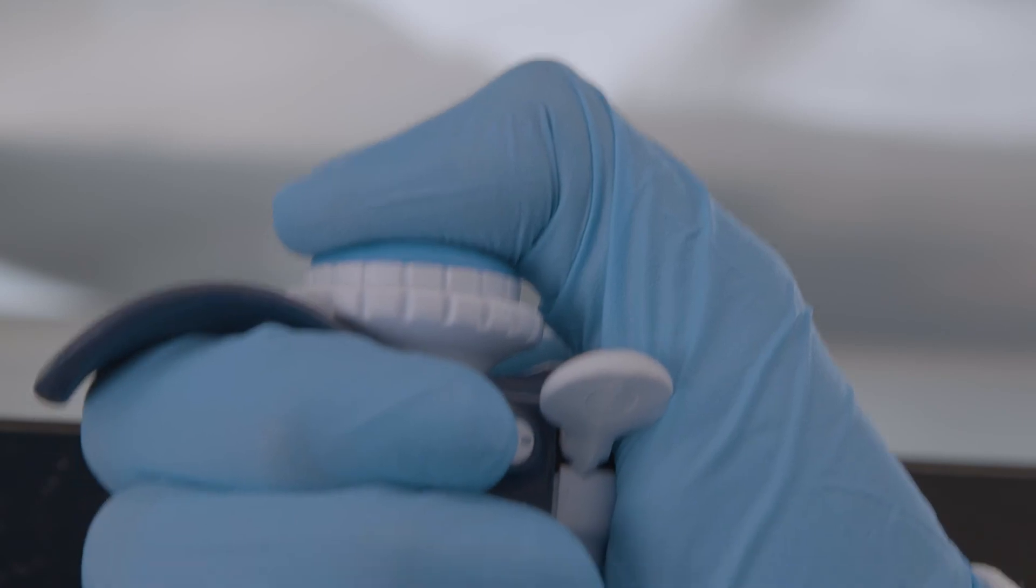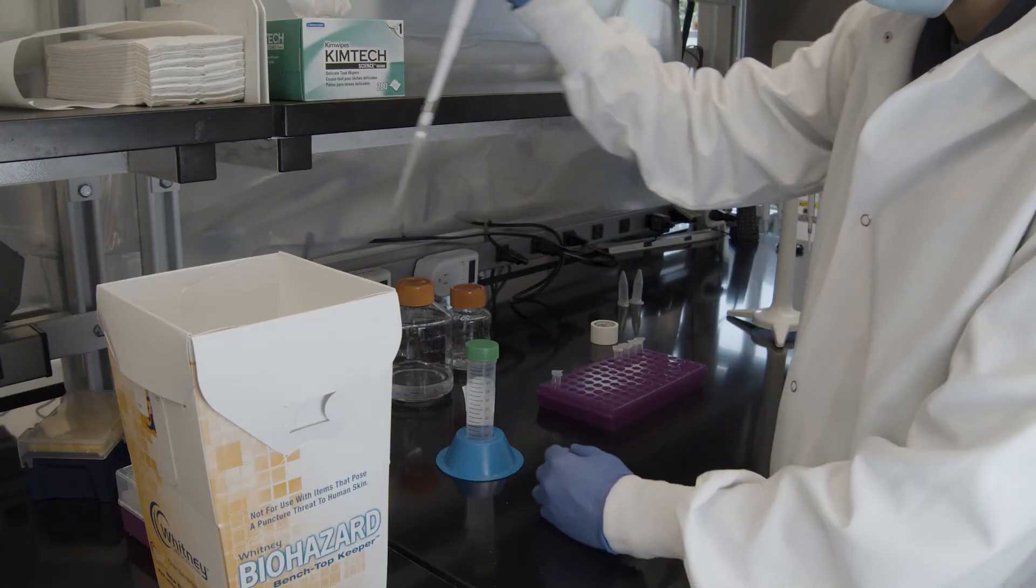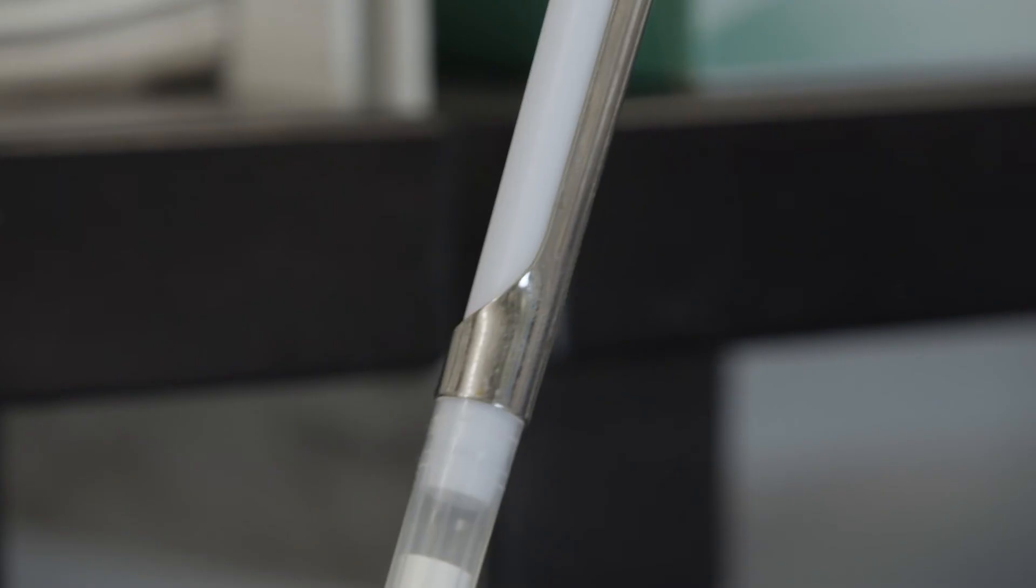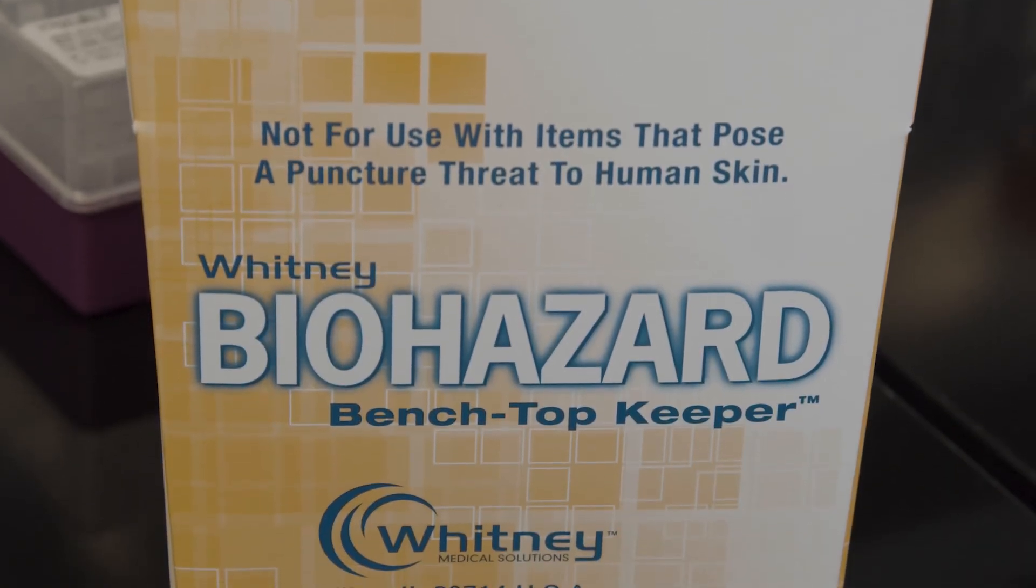Now, lift the pipette tip completely out of the liquid and release the plunger, being careful not to touch the sides of the container with the pipette. Discard the pipette tip by holding the tip over your dedicated waste container and pressing the tip ejector button. If you're pipetting biohazardous material, make sure to discard the tip into a biohazardous waste container.